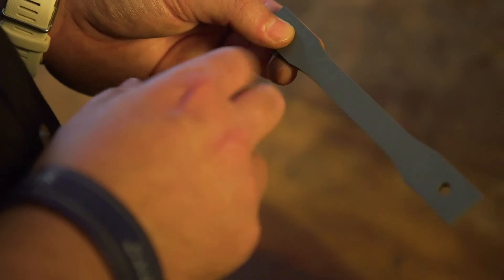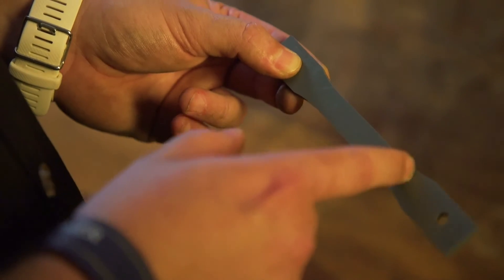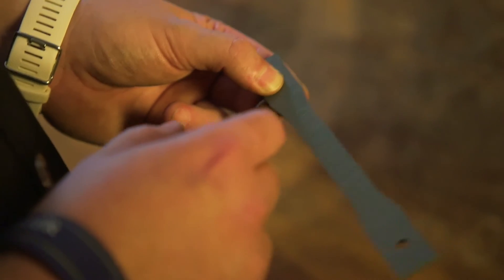I will also need to know the initial test length or span, which will be measured between the two fillets, but this will be determined when I set this specimen up on the universal testing machine.